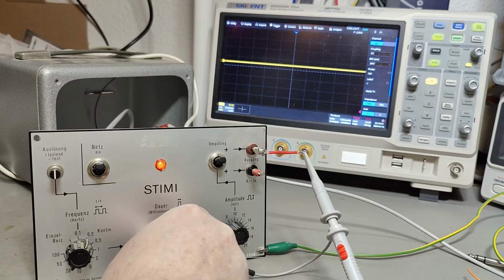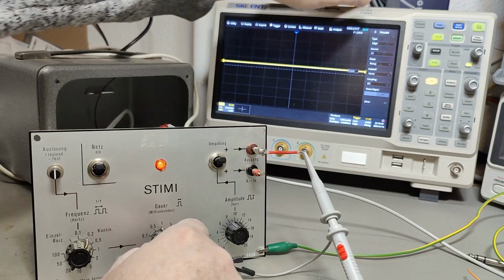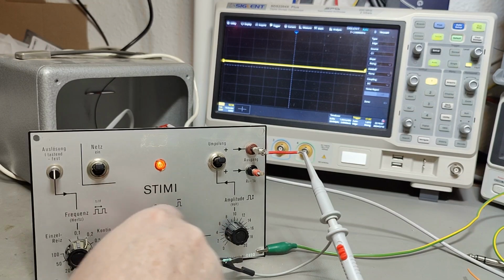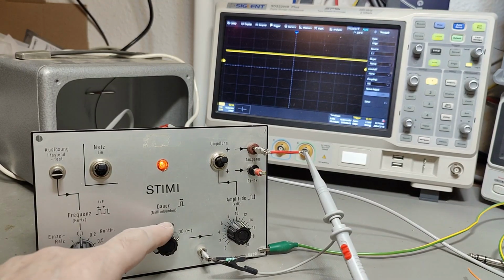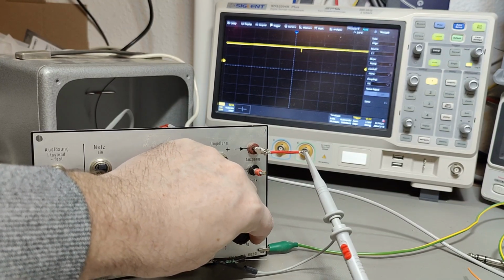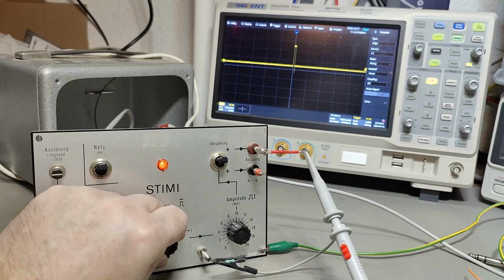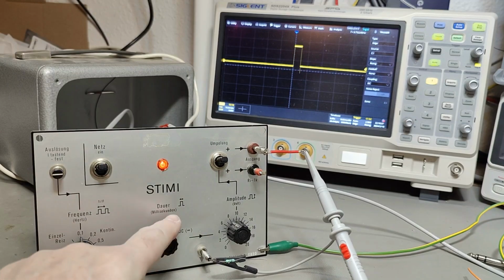Ah, look at that. There is a pulse set up. I'm dumb. It was just because my trigger here is not right. See? Something is going on, but. Really? Okay, it was me. Now I figured it out. So this is DC, and look at that. So here we got DC output, or now my maximum output level. And then here is the pulse width. And I can make it, of course, smaller and smaller and smaller. So this is the widest pulse width.